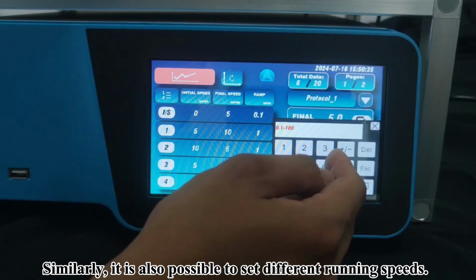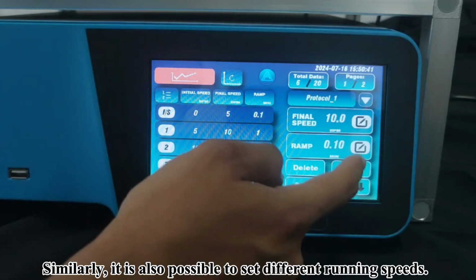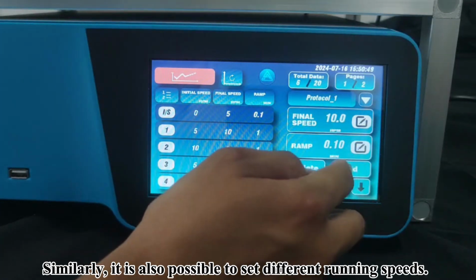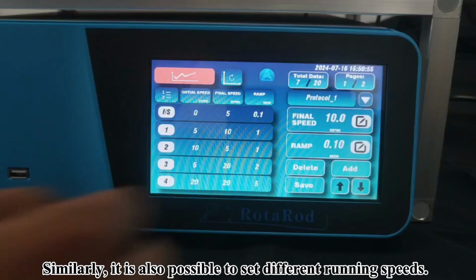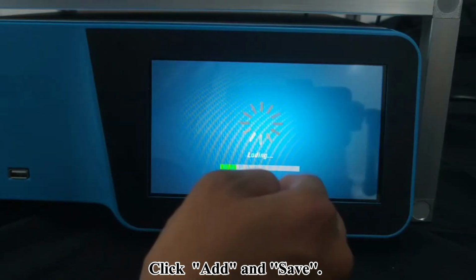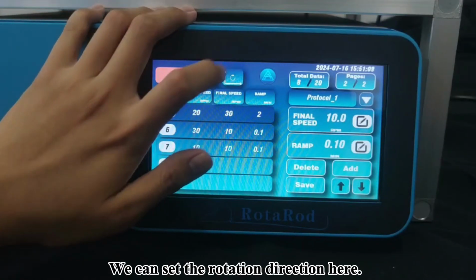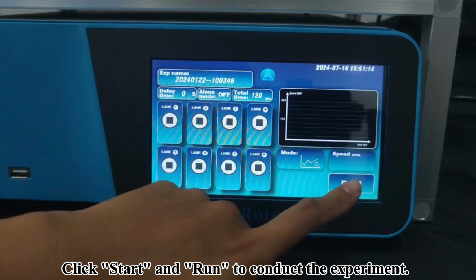Similarly, it is also possible to set different running speeds. Click Add and Save. We can set the rotation direction here. Click Start and Run to conduct the experiment.